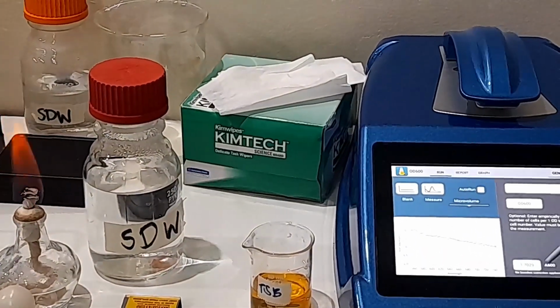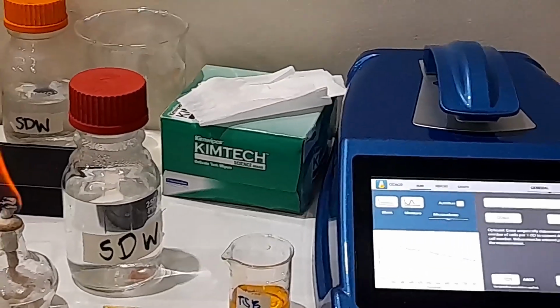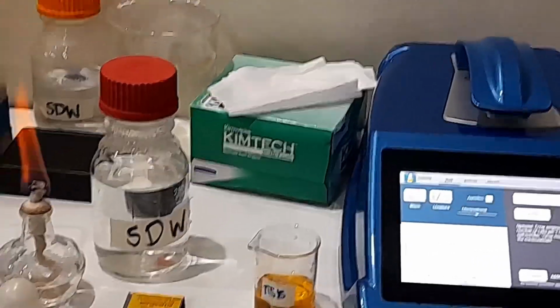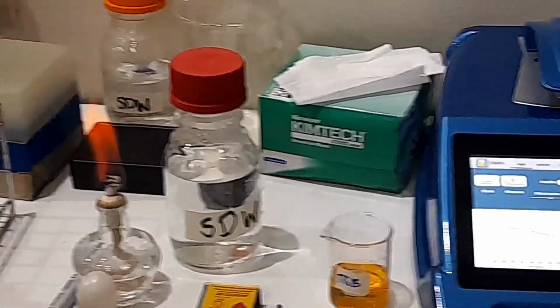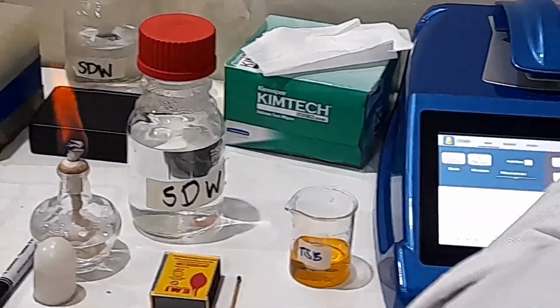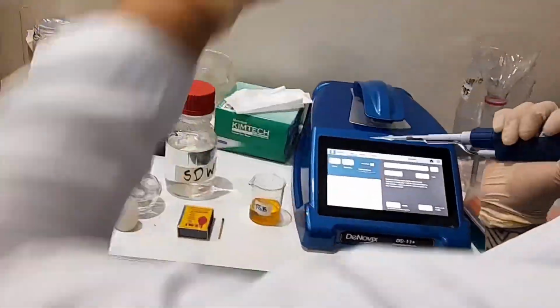If I want a reading between 1 to 2, and it's direct correlation. If I want a reading of 1, what do I do? 1 and 4? Oh, 1 and 4, right? But because this is within 1 to 2, we can just continue with this. So we just need to clean this. So all I'm going to do is just, again, the water.